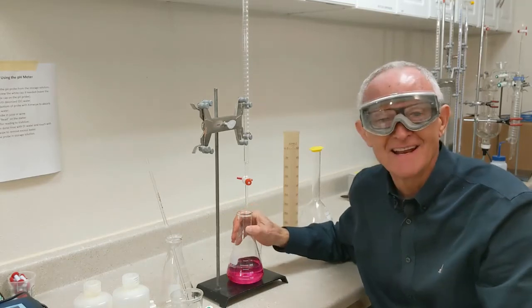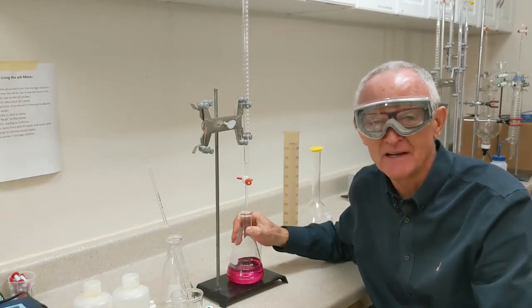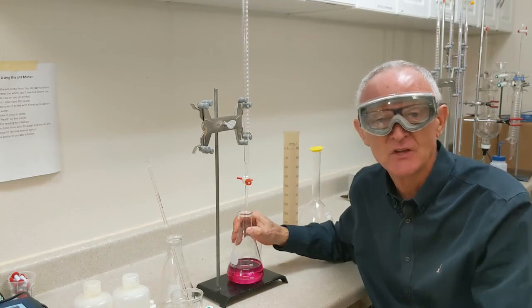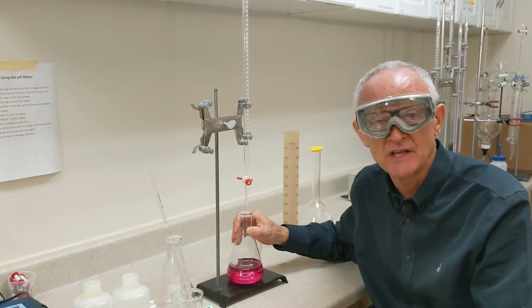Now it looks like the pink is starting to remain a little longer. You can see it spread out a little bit before it goes away. And I just overshot it. I turned it the wrong way. It happens to all of us. It'll happen to you for sure. Don't worry about it. This is practice. All you do is start over.